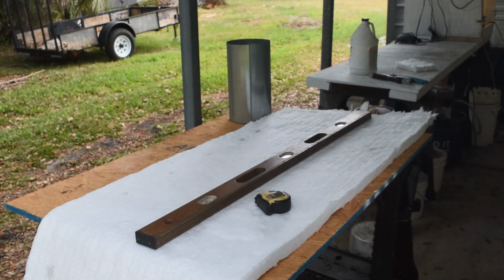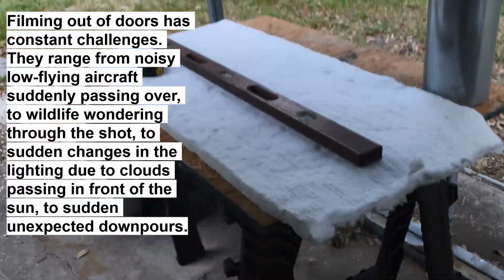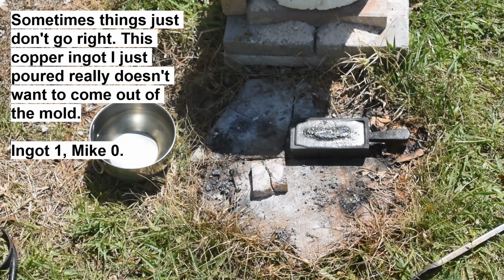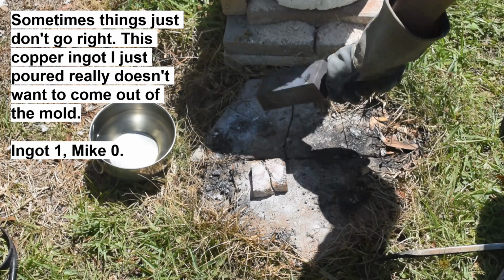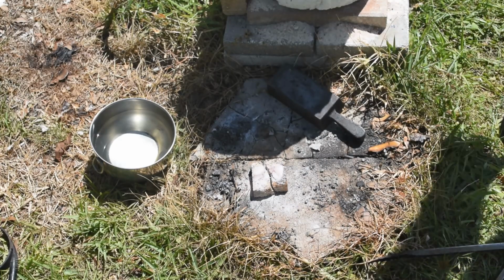Let me reposition the camera because it's starting to rain and the camera's out in the rain. Okay, let's see if I can get this thing out of the mold. It looks like maybe the slag has hardened up. Oh, I was afraid of that. Ow. Ow, that is hot.